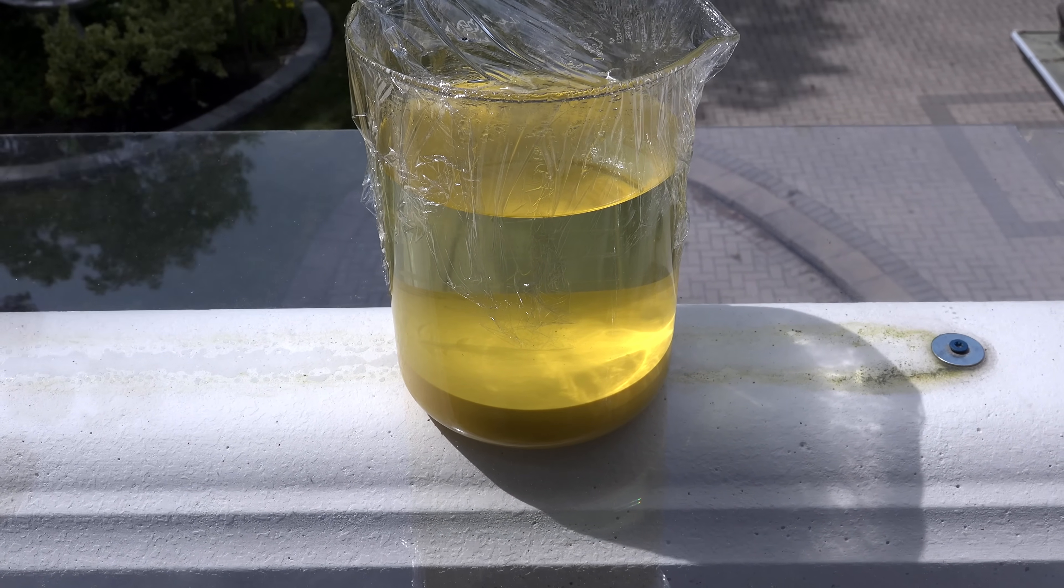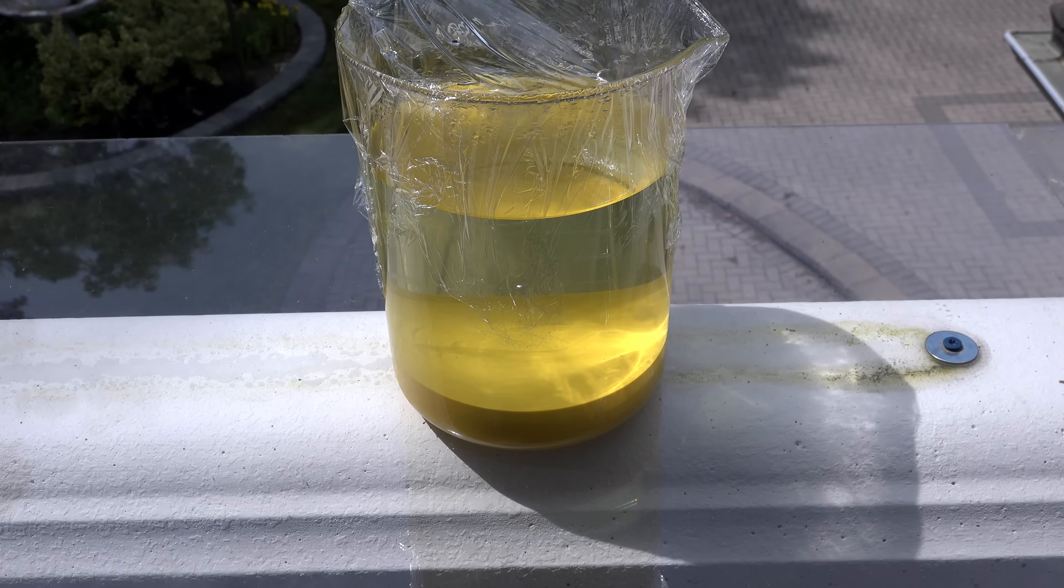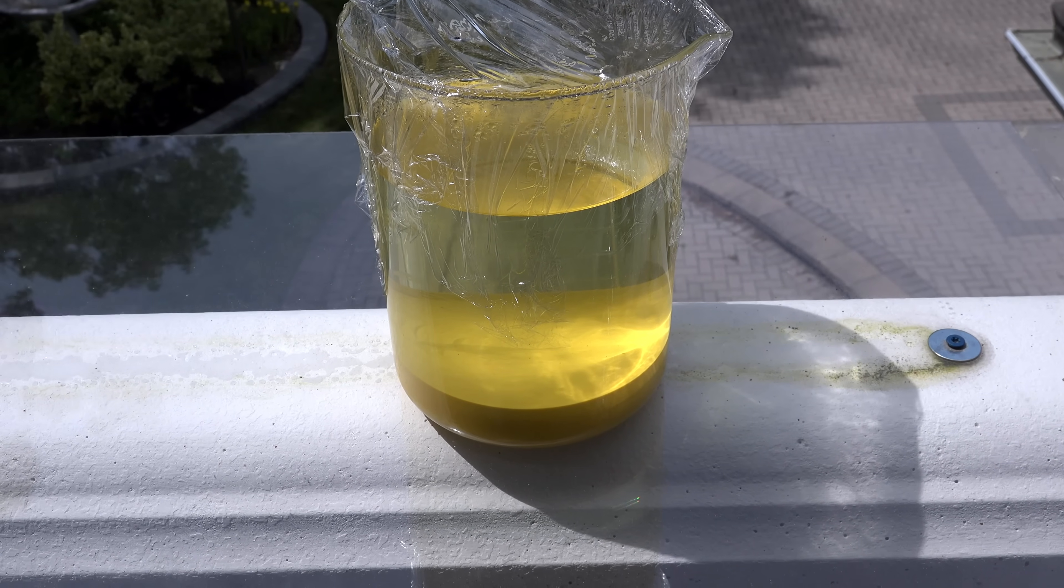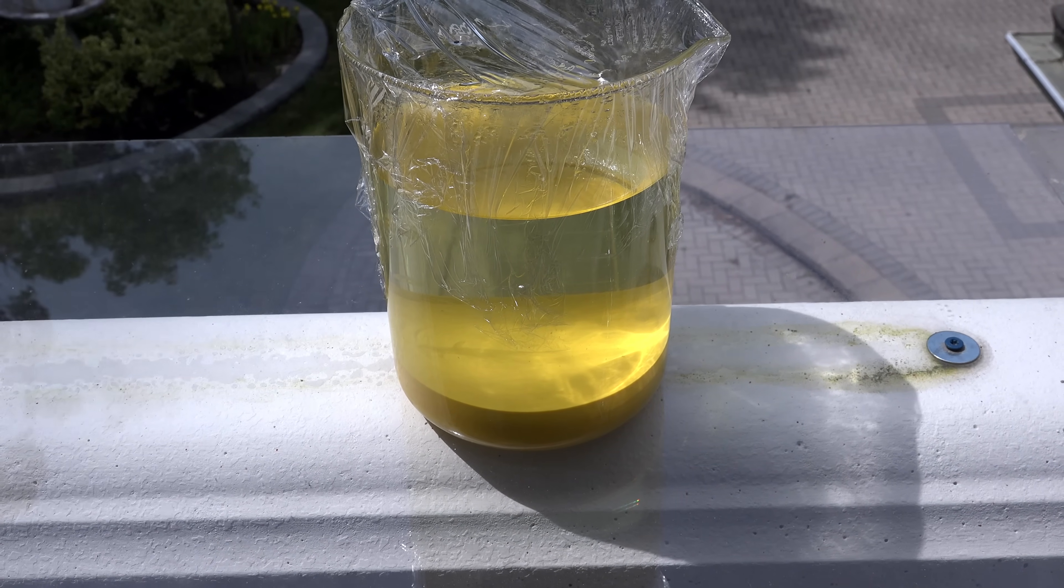I've redone the experiment with the exact same proportions as earlier with the 200g of oxalic acid. And before I filtered the iron oxalate, I left the beaker in direct sunlight for 8 hours.